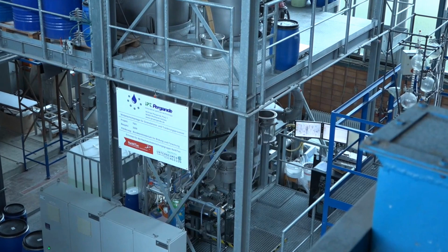So what we can see here, this is the tank which we are using for our spray nozzle. We have a two-component spray nozzle which we can place in top spray or bottom spray configuration, and we can also see some devices for measuring inlet and outlet moisture content. We're using an infrared spectrometer, which we calibrate with a dew point meter.